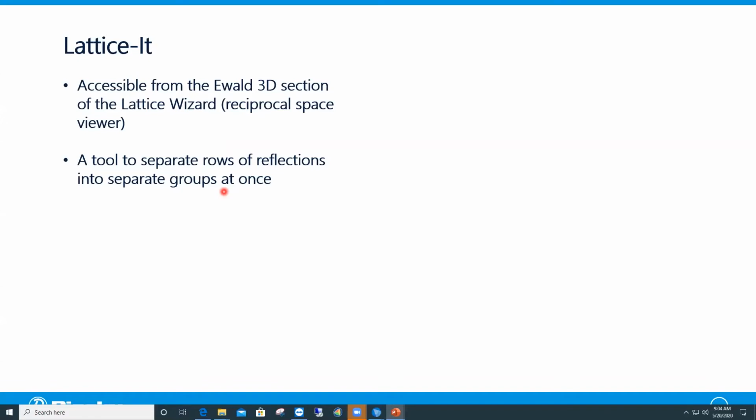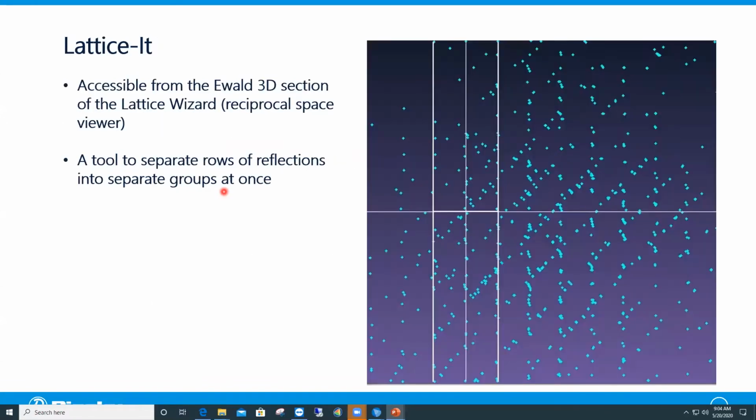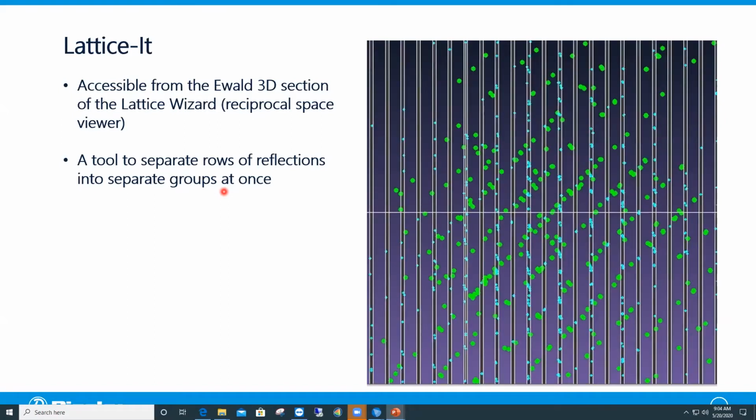So here is an example of what can happen. So if you have such a diffraction pattern with intertwined rows of reflections, once you apply Lattice-It to that view, this is what should happen, whereby Lattice-It is able to isolate one of the two sets of rows of reflections, in this case, the vertical rows, within bars.